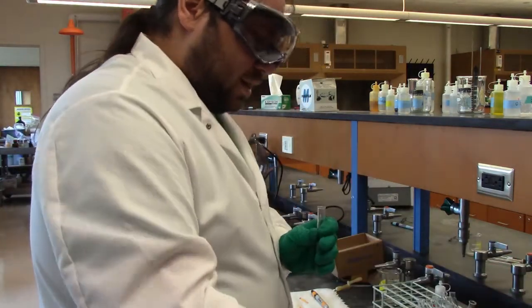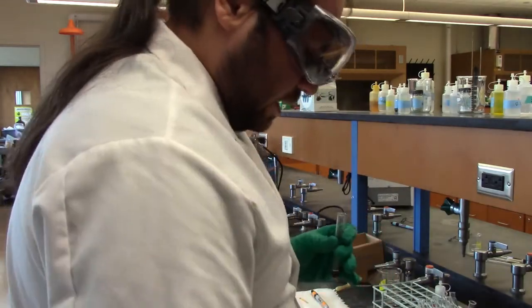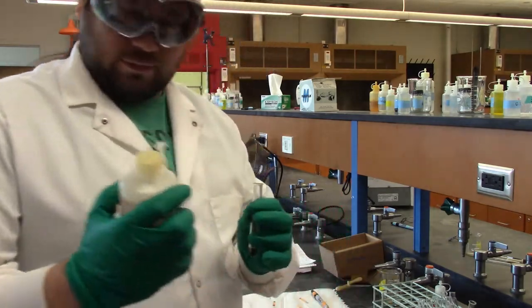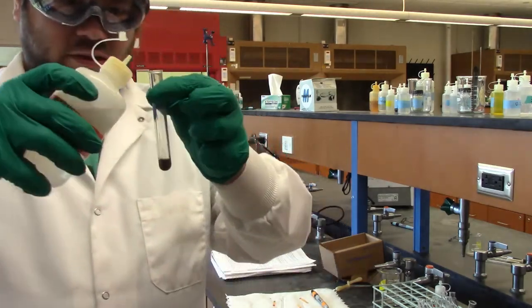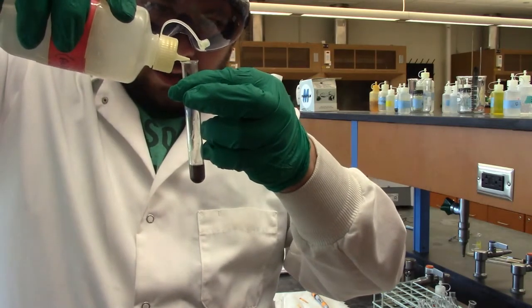Nitric acid is one of the fun acids that will eat your skin off if you get it on you. So can you show them the bottle so they actually see the chemical formula? See? Nitric acid, HNO3. So I'm going to add 10 drops of this, and we'll see if anything funky happens. Ooh, that's coming right out of there. I already stopped counting.